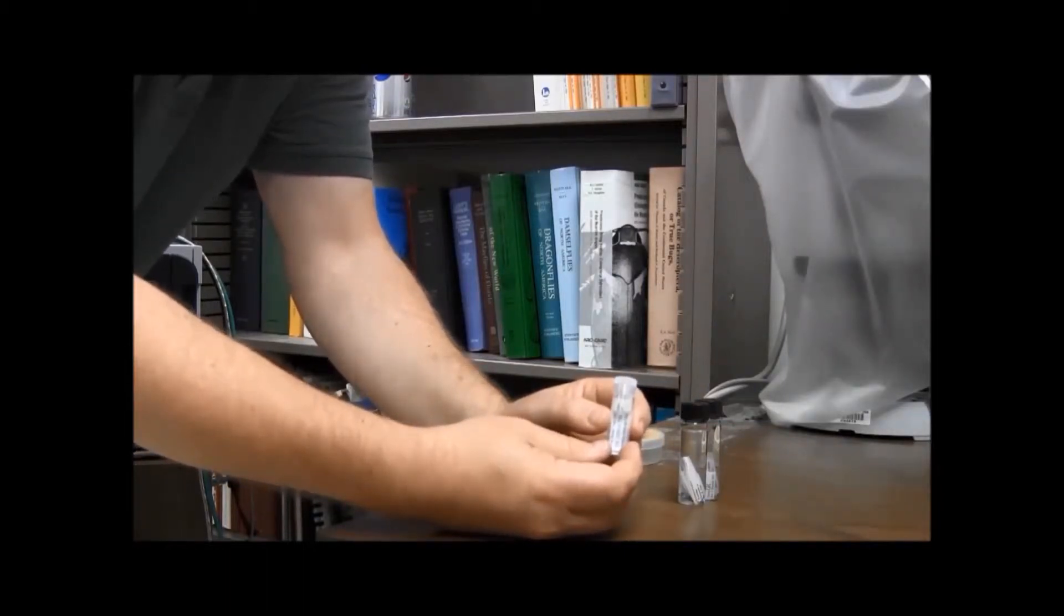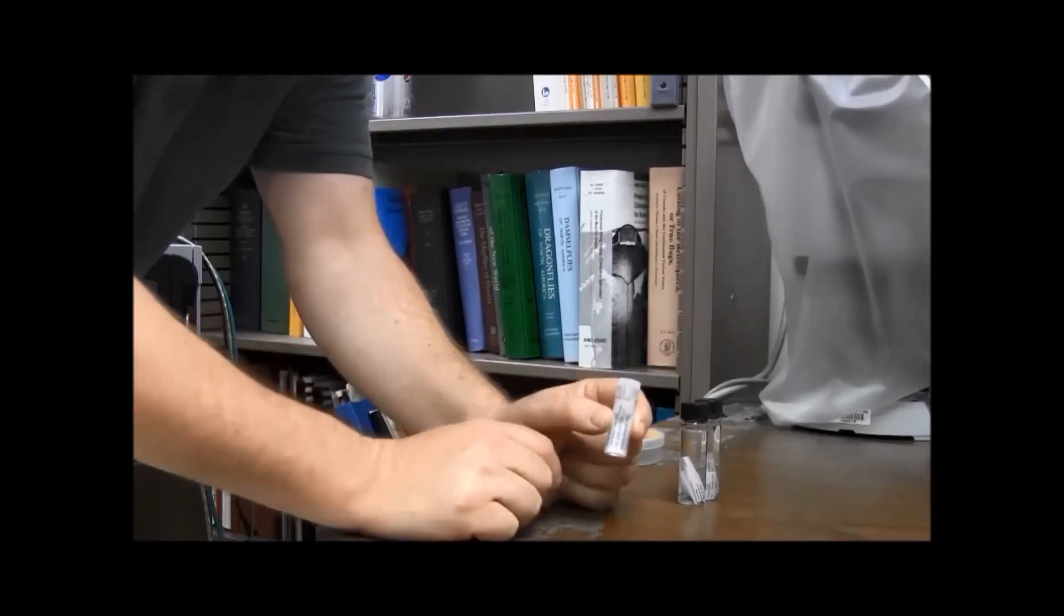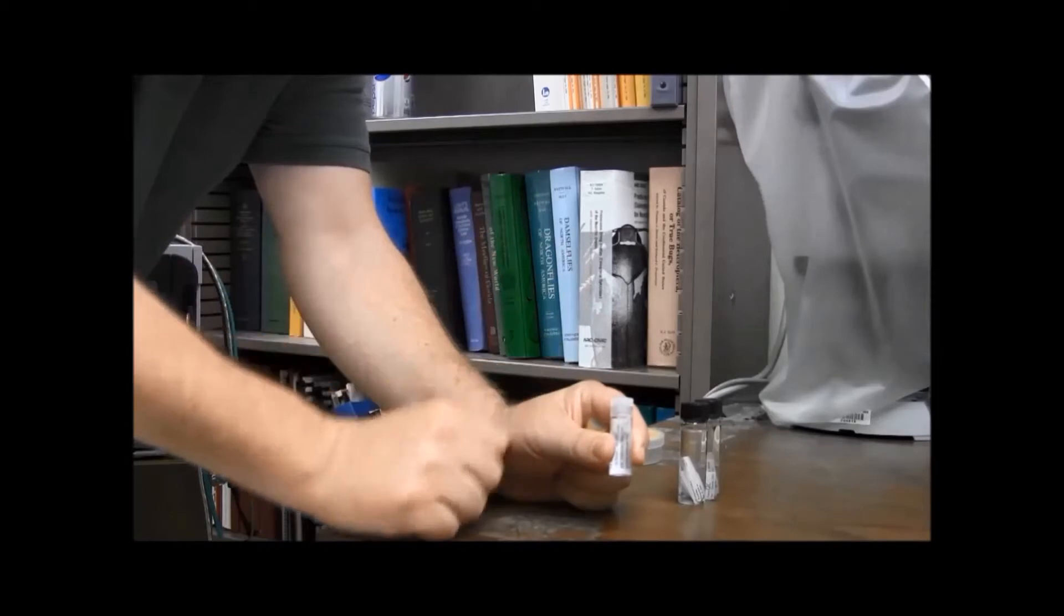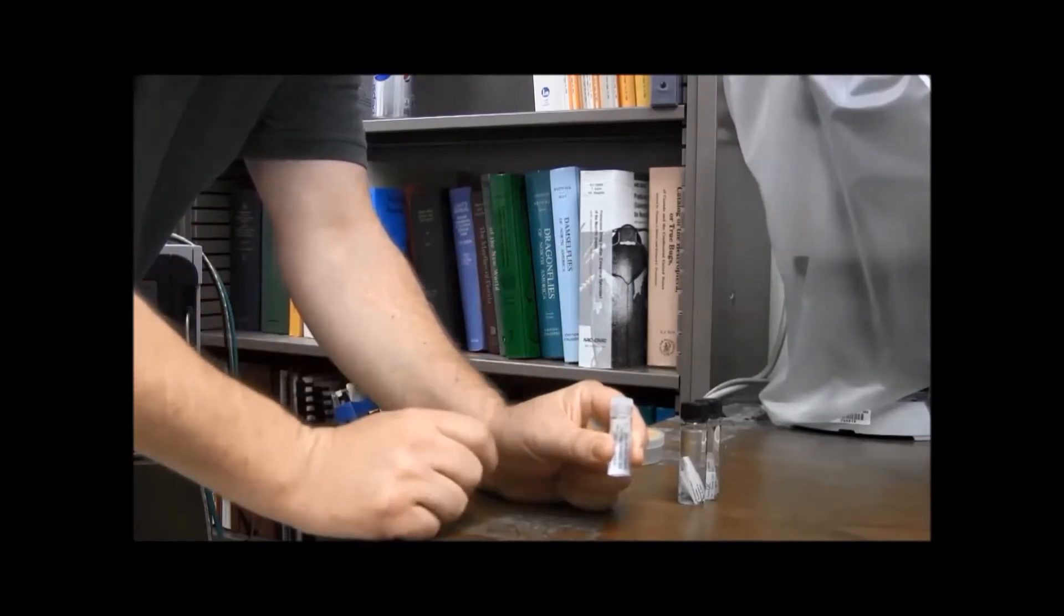If you're going to ship these by air, you're going to have change in pressure so the pop-tops can pop right off. If there's a change in temperature, they can pop off as well.